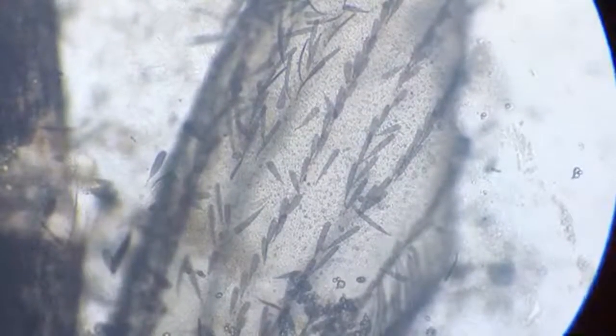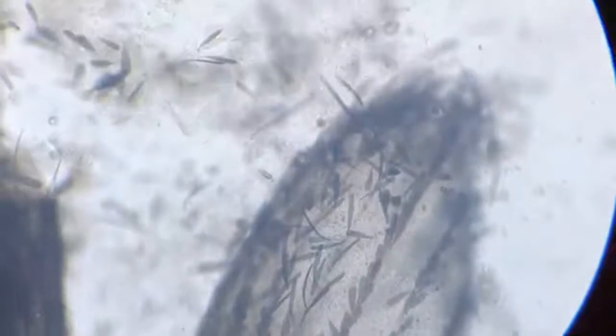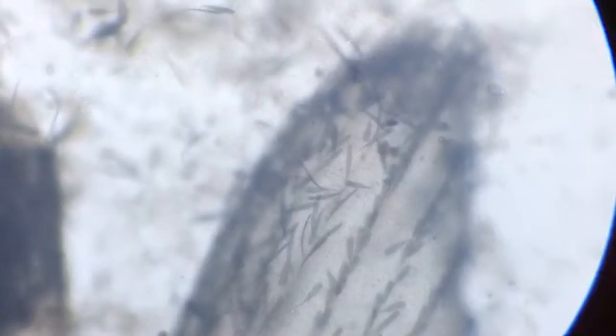Meanwhile, let's appreciate the architecture of the wings. This is the mosquito's wing at a very high magnification, and it is undergoing a sort of decay done by those ciliates and other microorganisms.